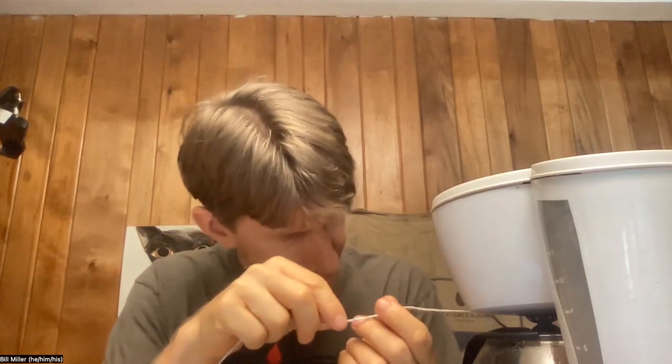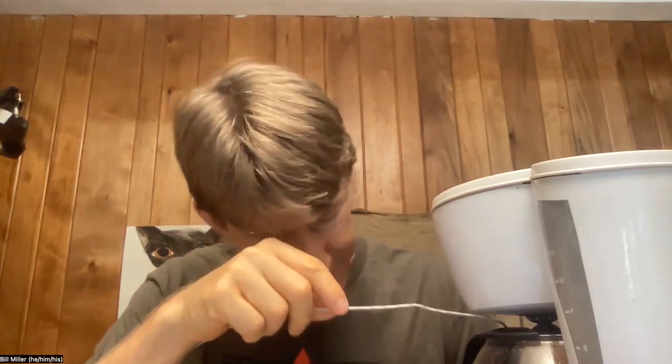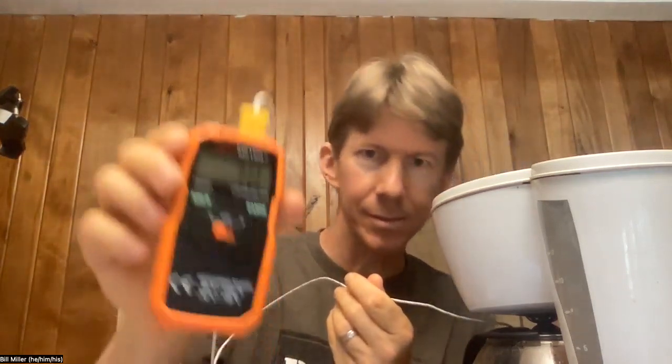Let's see if I can get this in. And this coffee is actually at 71 degrees Celsius. I don't think there's a place to write that down, but that will definitely affect things. Just leave it in there somewhere where I can see it. Pretty constant — it's 70 degrees Celsius.